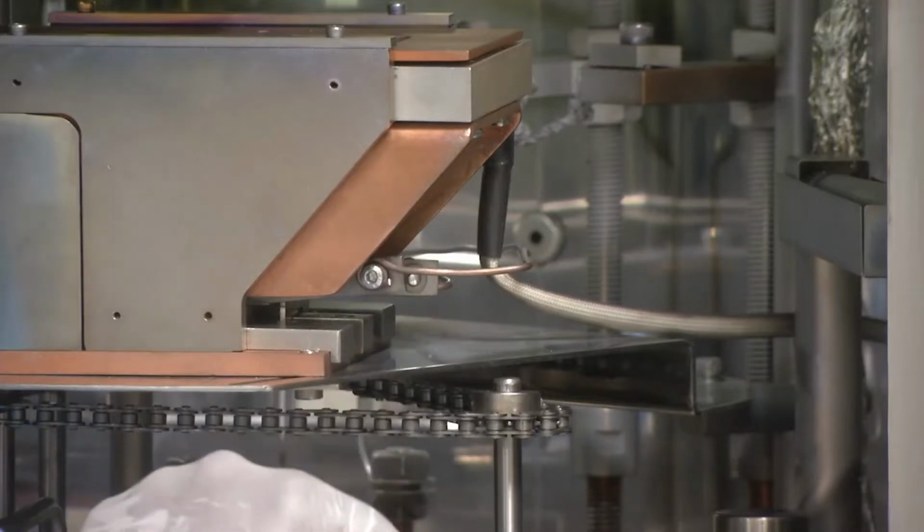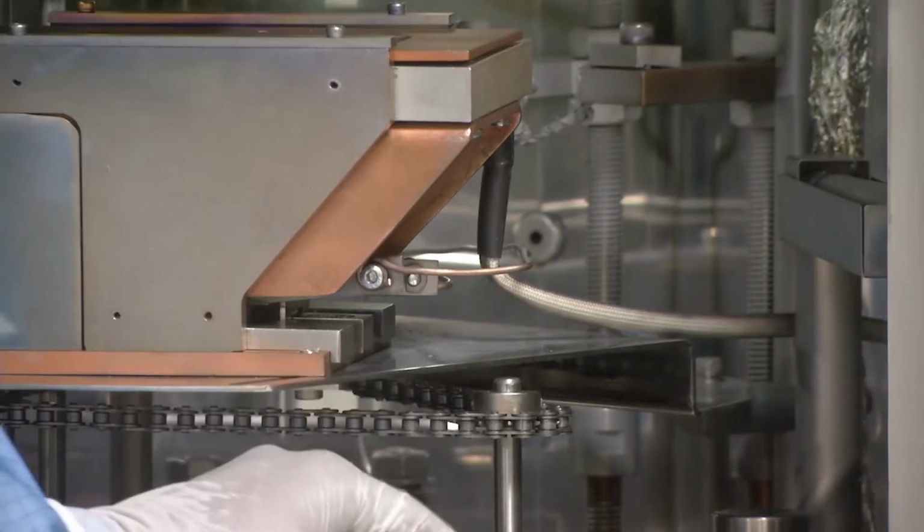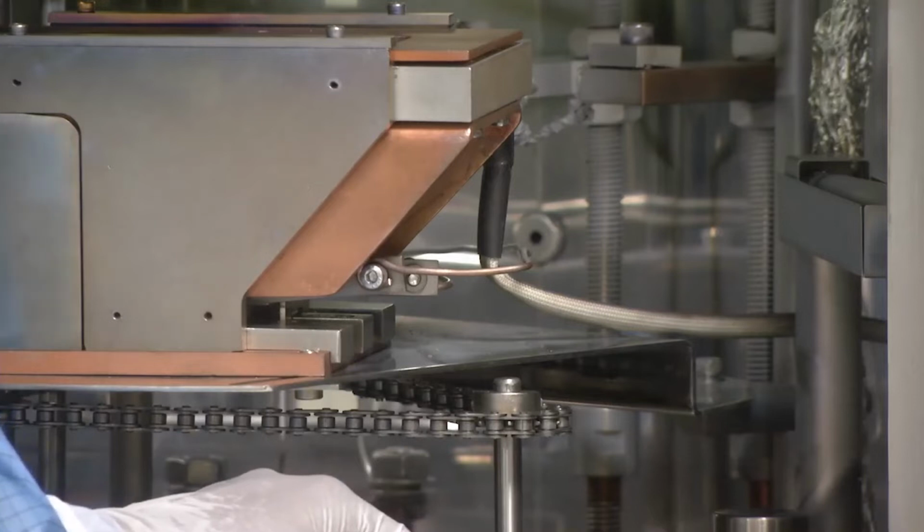The idea for using a filament is that when a sufficient amount of voltage is supplied to the filament, it generates an electron beam. So in a way, it is the source of the electron beam. Typical voltages we are talking about are 3 to 5 kilovolts, which vary from system to system for a unit meant for laboratory research purposes. As we go higher up for commercial usage, the potentials may vary.